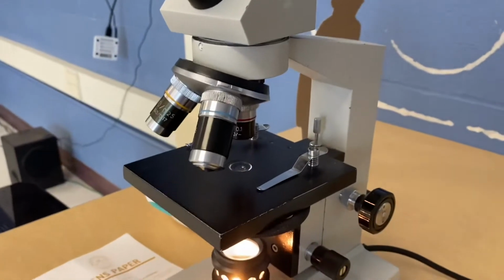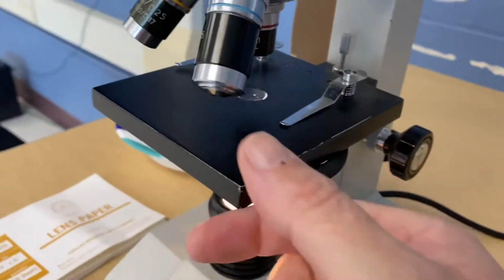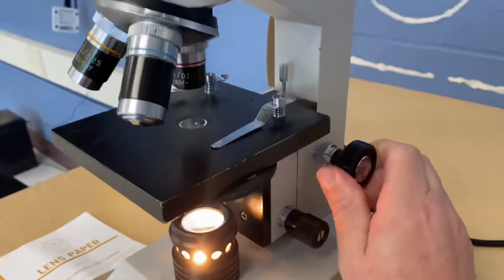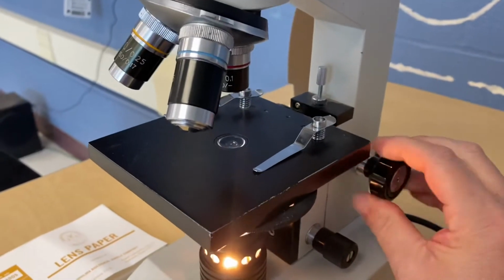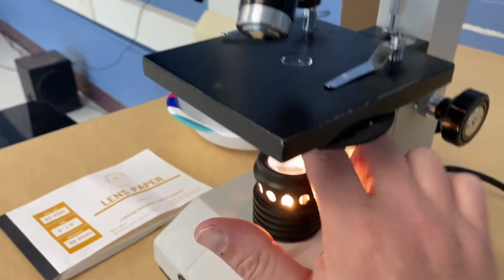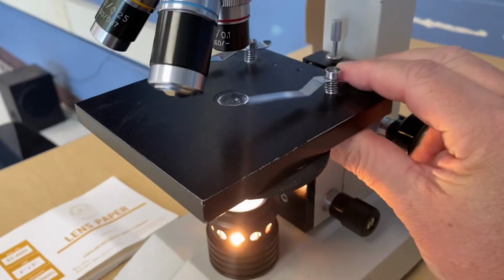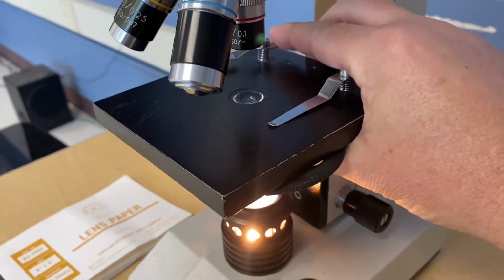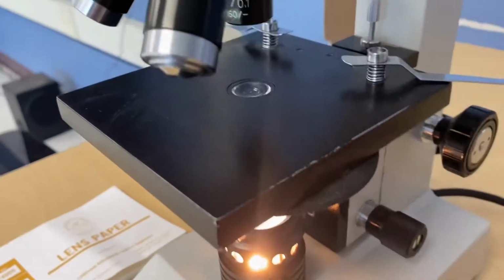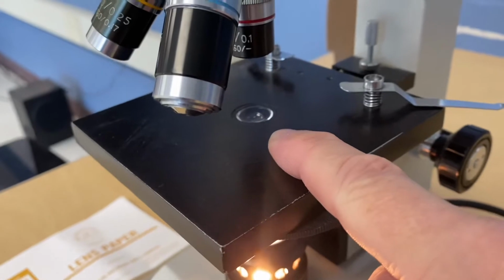Our next question. I'm on a different microscope. Oh, look. So this black square part, when you turn the coarse adjustment knob, it goes up and down on this microscope. There is a light source underneath it that beams through a little hole on it. A lot of ours have these little clips, but to be honest, I don't like them. I put them out of the way because they get in my way. It's the place where you put the specimen.